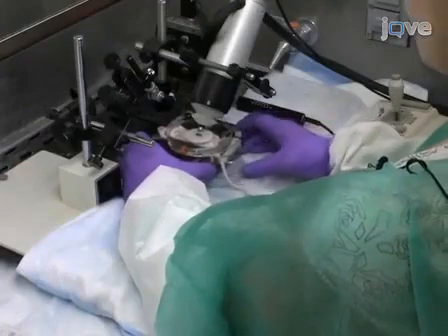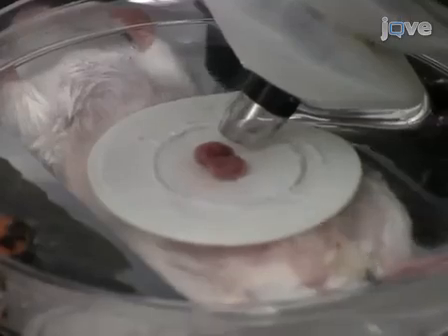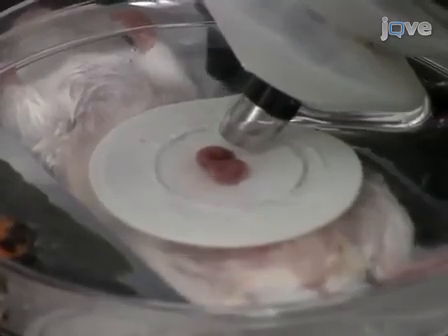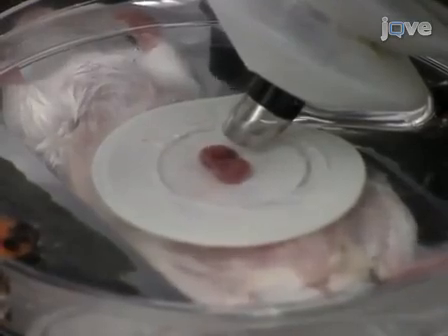Place the injection stage under the ultrasound probe. Lower the probe to approximately 2 to 3 millimeters over the embryos for clear ultrasound images. It is crucial that the probe head does not hit the embryos as it oscillates back and forth collecting images.